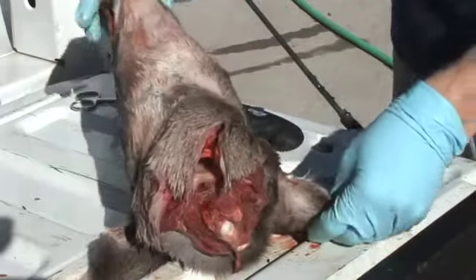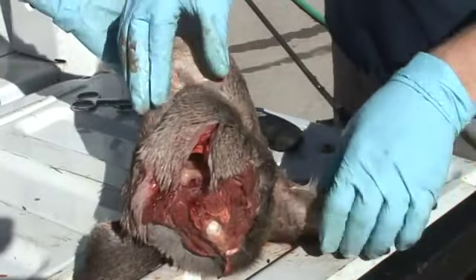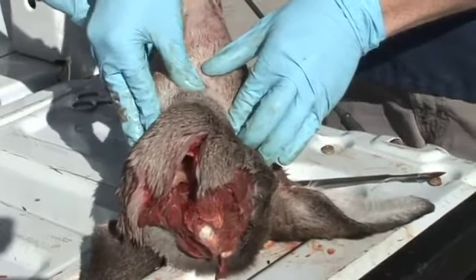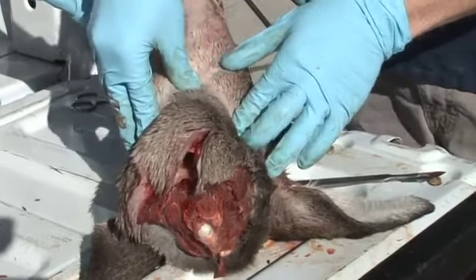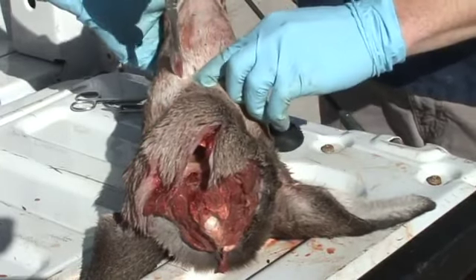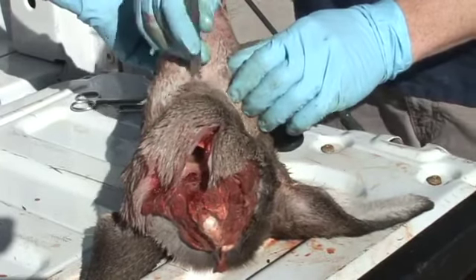The larynx is the large laryngeal cartilage at the ventral side of the animal's neck. In this video, I take the time to palpate and identify this cartilage. With my finger, I create a small indention at the cranial margin of this cartilage. With the scalpel, cut directly into this indention.